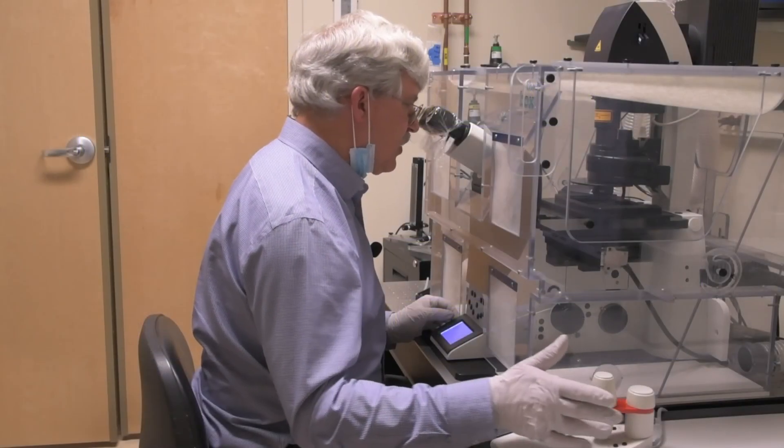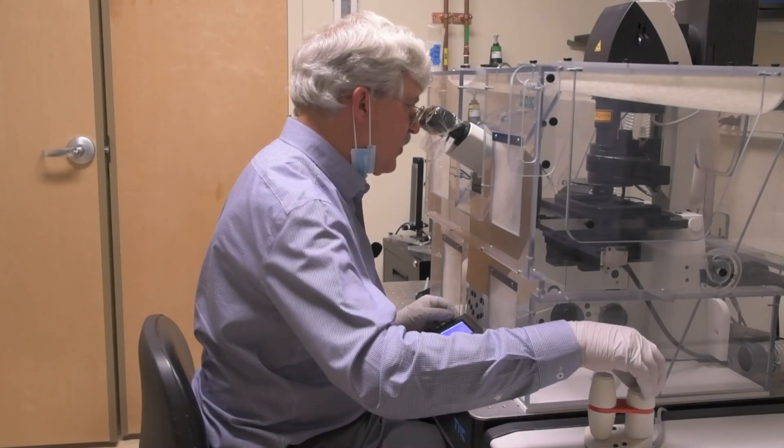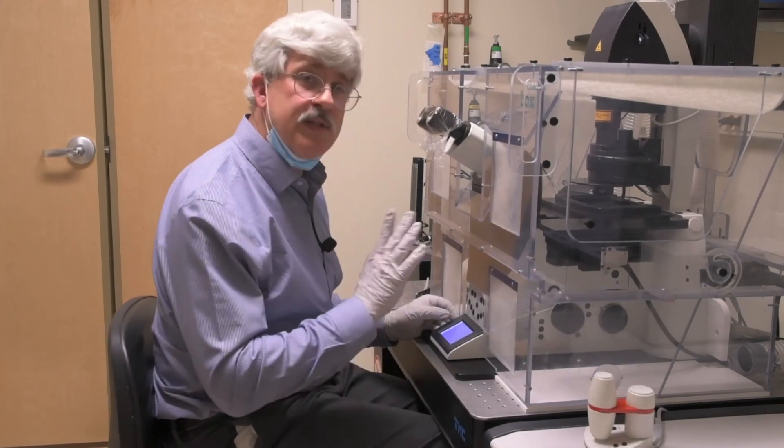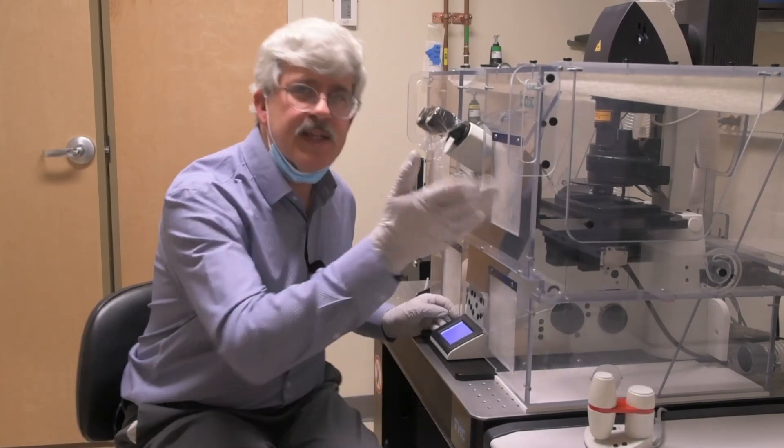Just use the XYZ controls until you find something of interest. Once you've found it, just punch them in the nose, close the shutter, and we're ready to go over to the confocal.